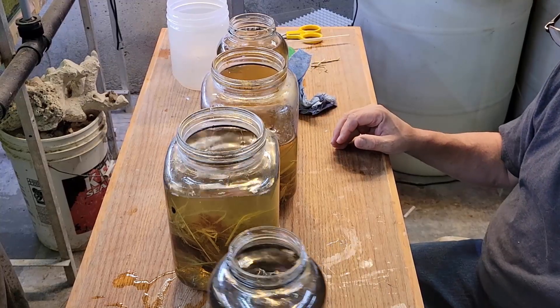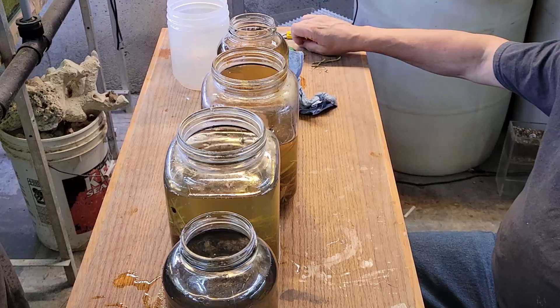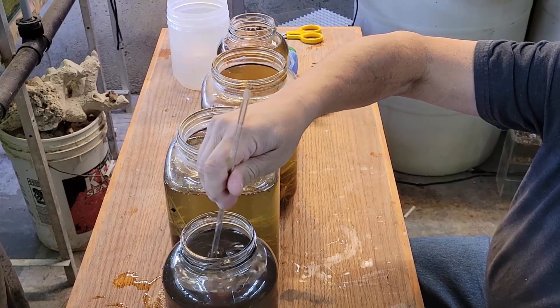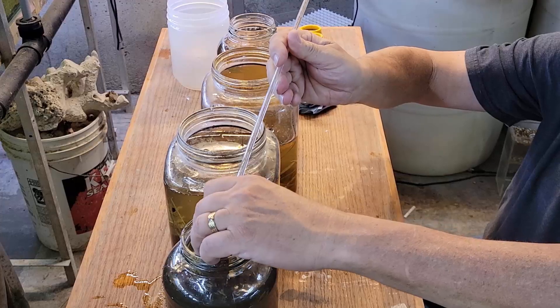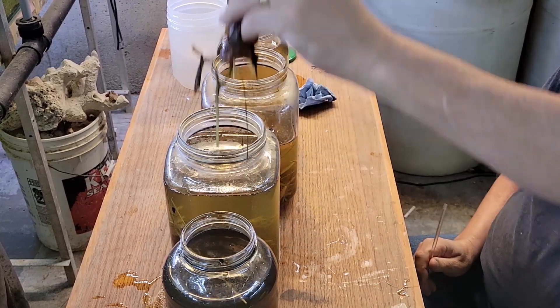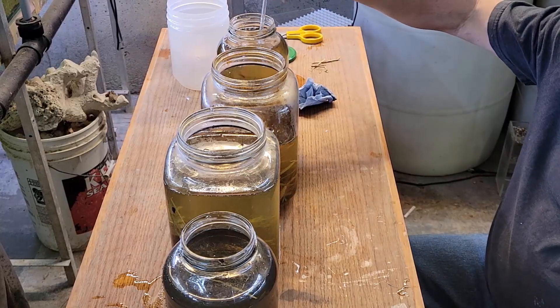What I do is — if I have four here, and I have five or six going currently — if one is not thriving, I'll pour that one out completely, throw that whole thing out, clean the jar, and then that will be what I subculture into. That way, like I said, you have the best materials at all times. You can see I'm not measuring anything here. I am definitely going by feel. I've been doing this forever, so it is a bit easier.